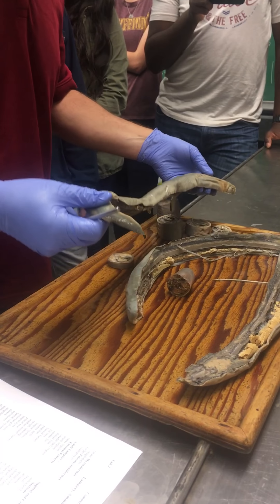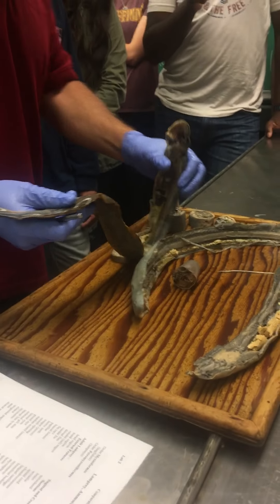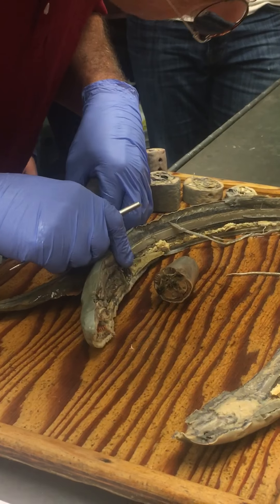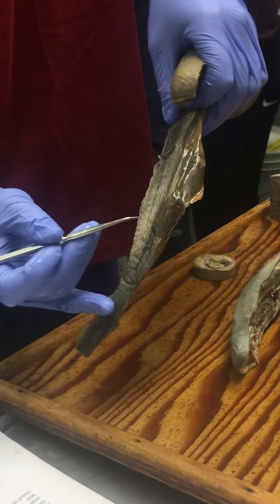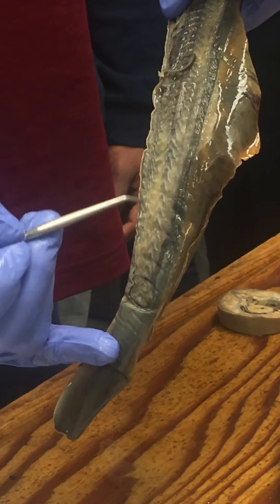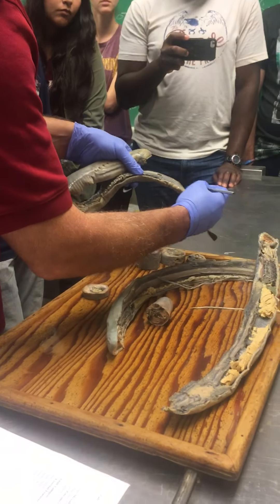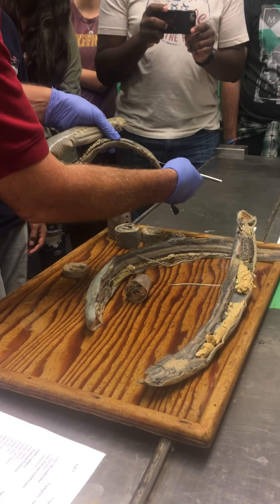Myomeres don't look very impressive from the outside of a lamprey, but if you look at a slice through it, you can see these segmental blocks of muscle, and you can see how they're W-shaped like that. The point at the tip and middle of the W points forward. Here are the myomeres, and the point is pointing forward.